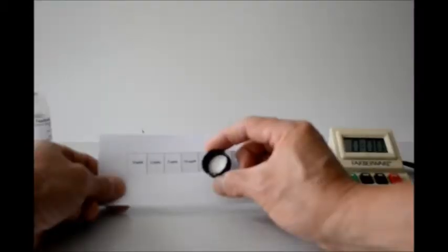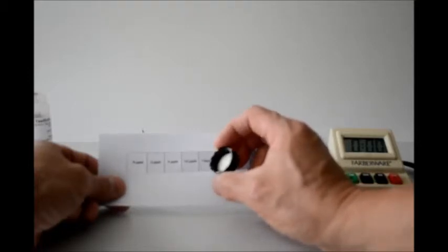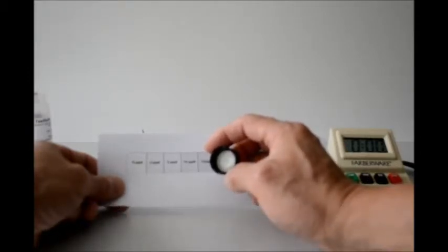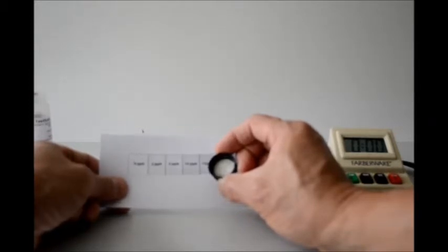The result shows there is very little arsenic. The discoloration that you can see here in the detector cap is very faint. I would estimate it in the 2 to 5 parts per billion. It doesn't mean the sample or the protein shake you use doesn't have it, but it will be well for you to test for your own safety and peace of mind whether there is enough arsenic present to constitute a hazard for you.